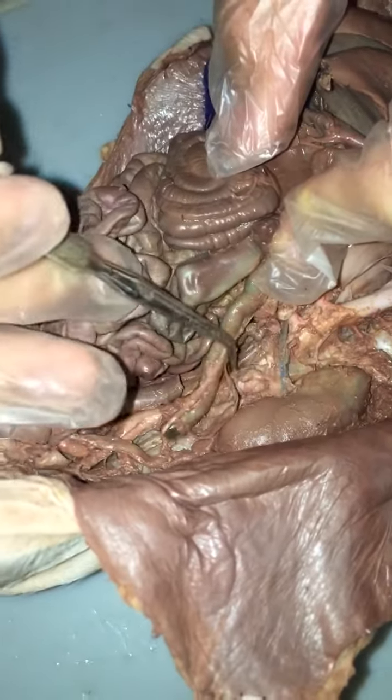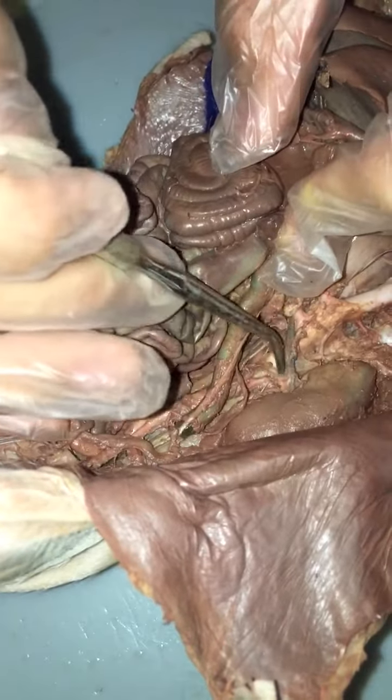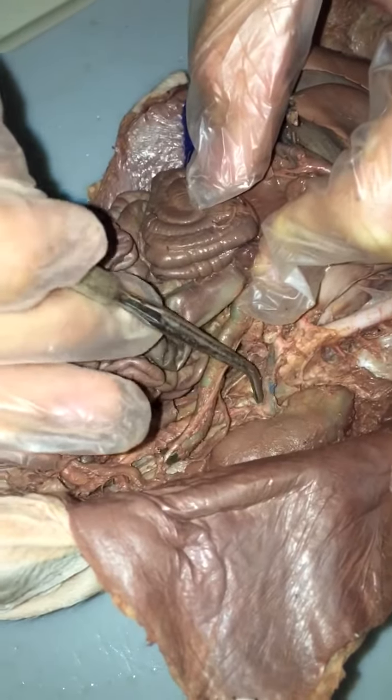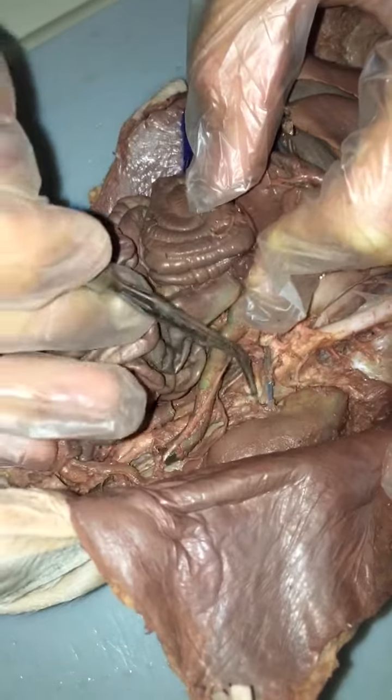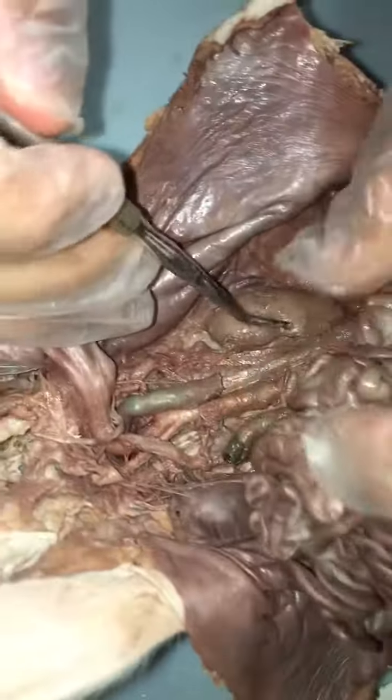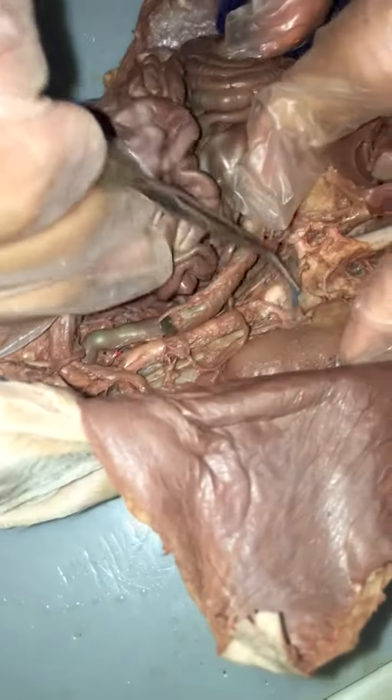Should be the red one. Yeah, it should be red. But, well, you can see the renal vein right here. Renal artery is under this connective tissue still. How many are there? Well, one to each. There's a renal artery and then a renal artery on the other side also. Oh, this is still covered. Renal vein is this one right here.